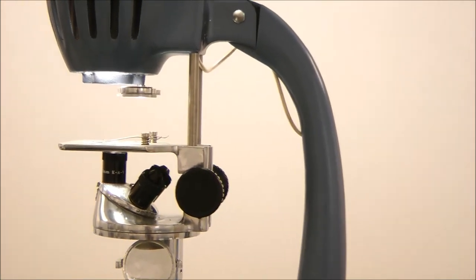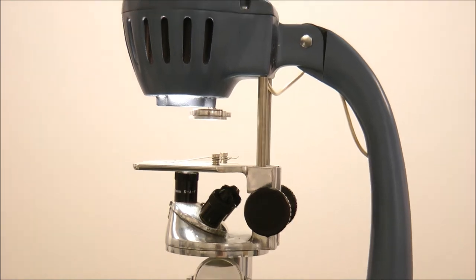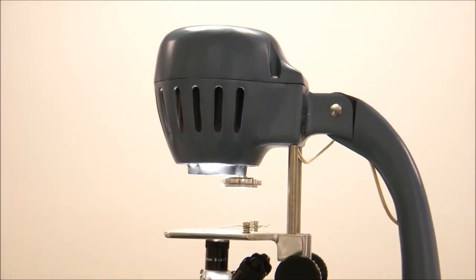You will notice in the head of the microprojector the light source should be on.